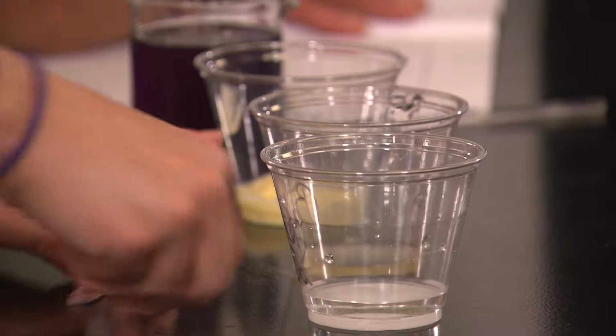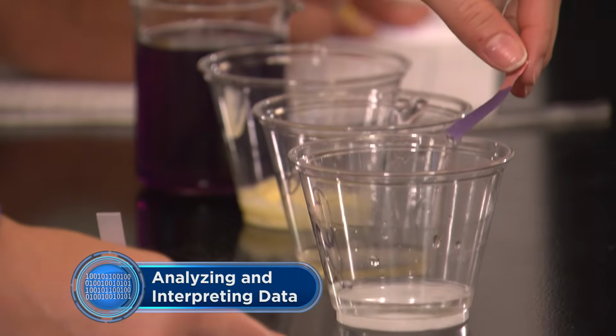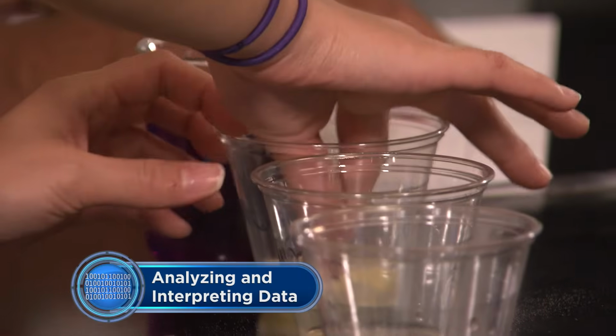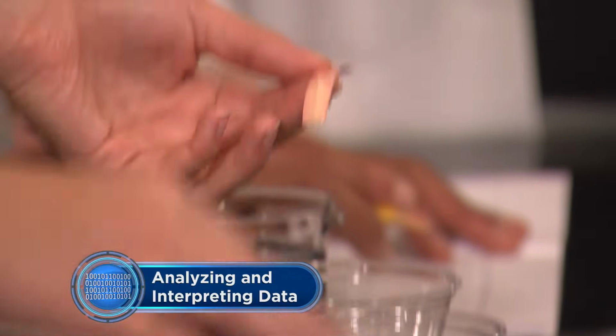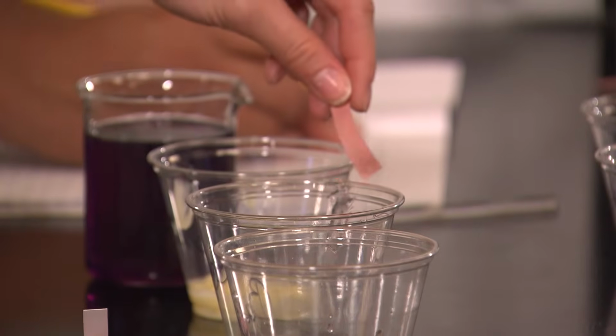Okay, since everyone's done, let's discuss your results. Team 1, tell me how the red litmus test went on your solutions. Well, the biggest impact was the baking soda. It turned blue immediately. I was watching you work and I was surprised by your shampoo and conditioner results. I expected them to turn the red litmus blue also. So how did you guys classify the baking soda? Acid or base? It was definitely a base.